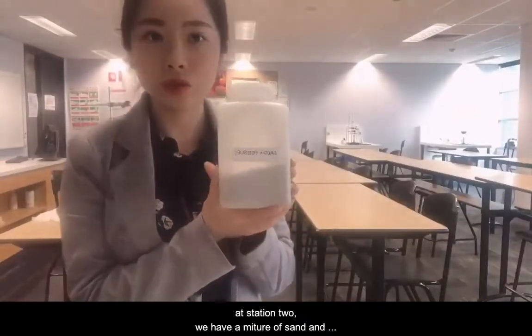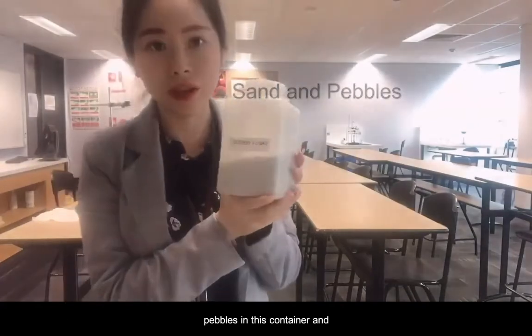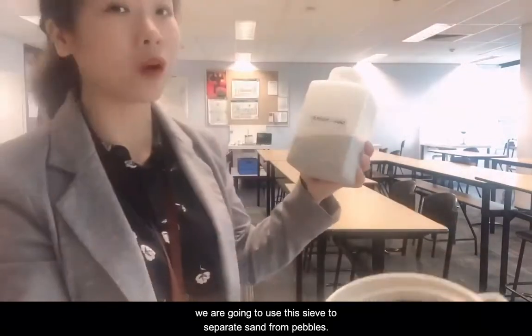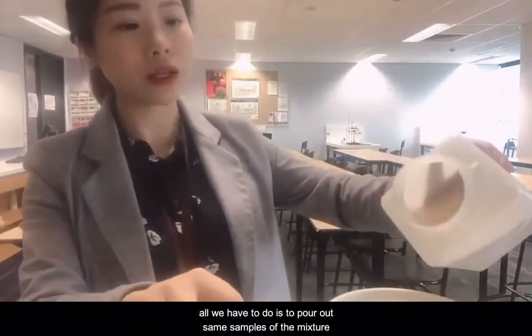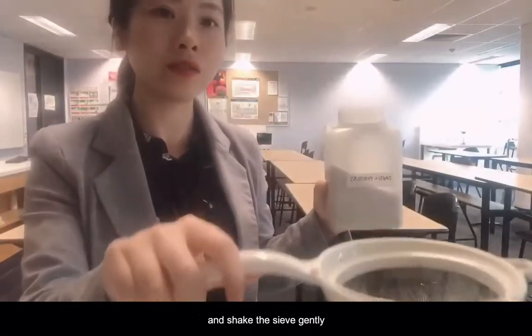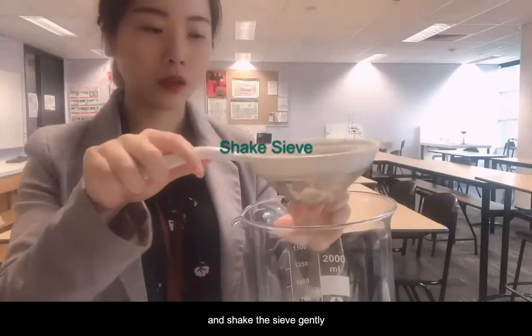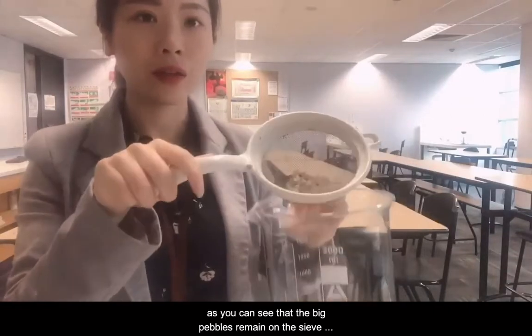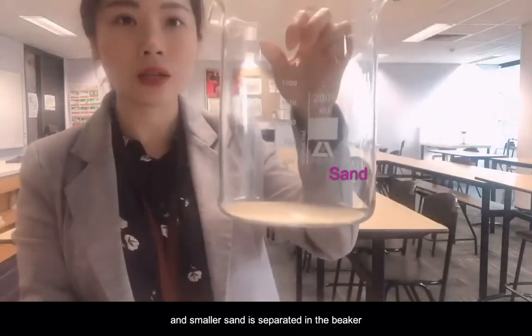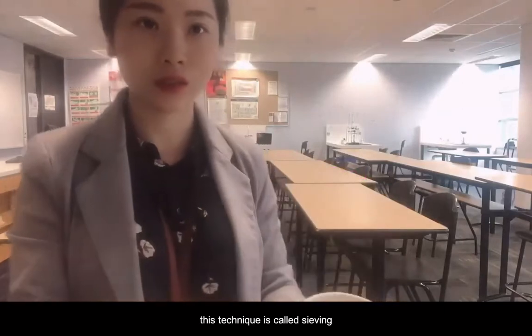At station 2, we have a mixture of sand and pebbles in this container, and we're going to use this sieve to separate sand from pebbles. All we have to do is pour out some samples of the mixture and shake the sieve gently. As you can see, the big pebbles remain on the sieve and the smaller sand is separated in the beaker. This technique is called sieving.